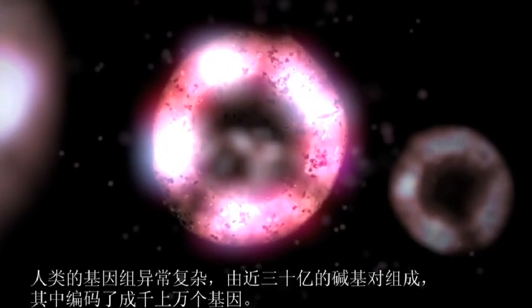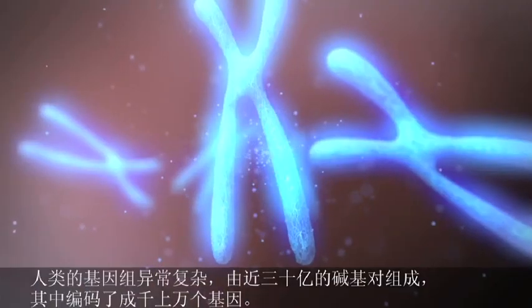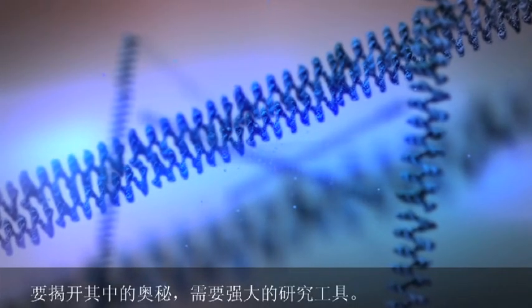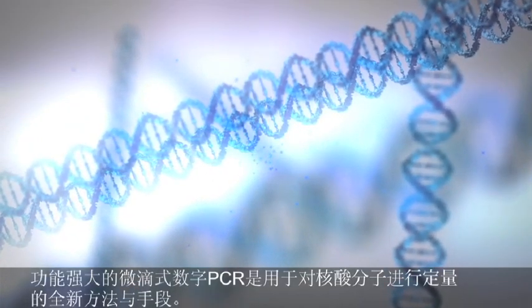The human genome is of extraordinary complexity, with its 3 billion DNA base pairs that form the thousands of genes that make up our biology. Understanding this complexity requires powerful tools. Digital PCR is a powerful new tool for quantitative DNA measurements.